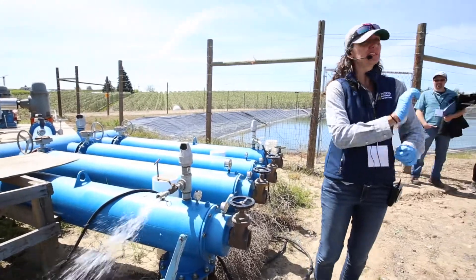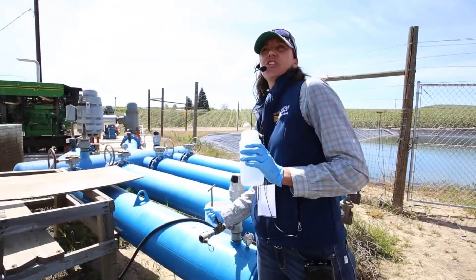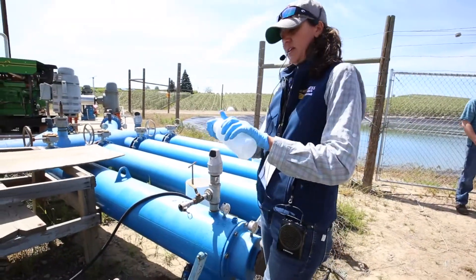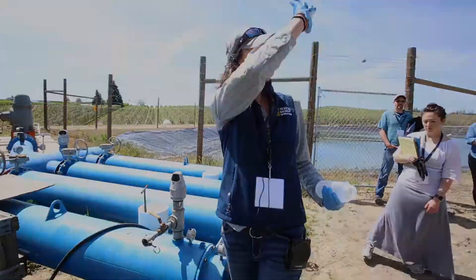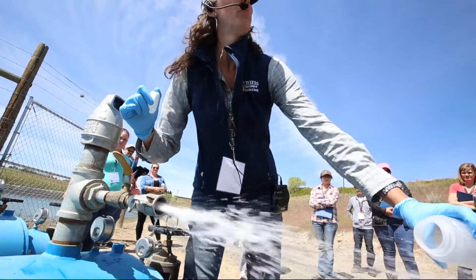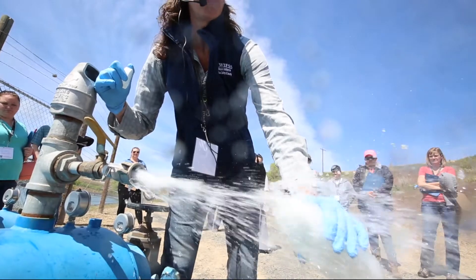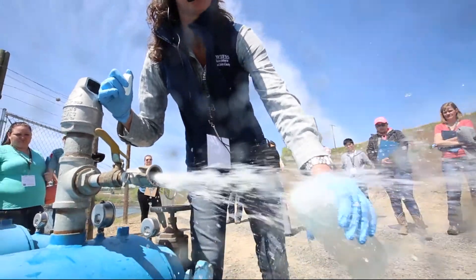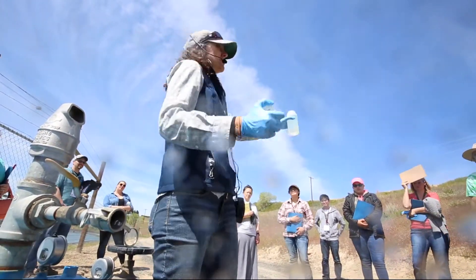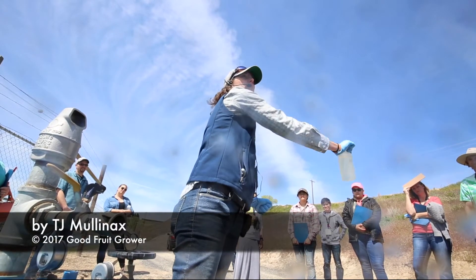If you've set your sample bottle down someplace, now would be the time to pick it back up and hold it under your armpit. I usually turn the water off again just to make sure I'm ready to go. Got my sample bottle picked up, I'm not standing in a puddle. I've got my cap secured in my hand. When I've got a good grip with these three fingers, I'm going to open up the water again and put my bottle inside it. You might need to tip the bottle a little bit because a lot of air is going to come into it. I've got headspace on that bottle — still good grip on my cap. Secure it. This goes now into my cooler and you're done.